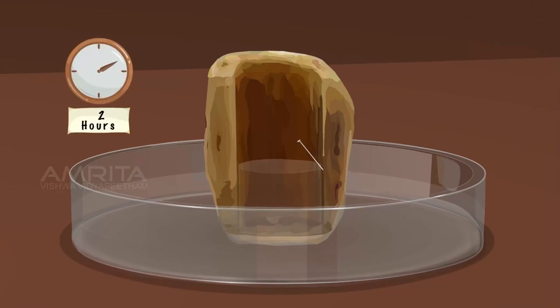The potato now functions as an osmometer. Leave the osmometer undisturbed for about 2 hours.